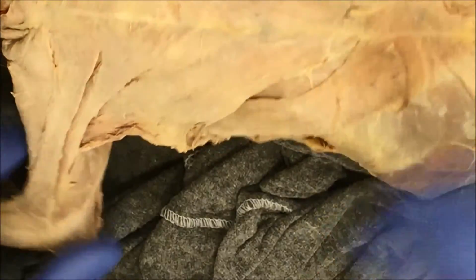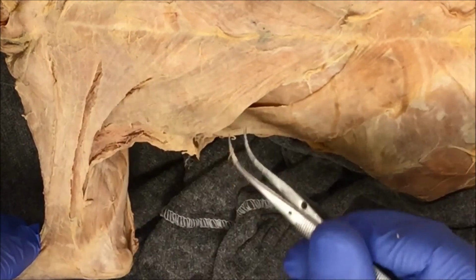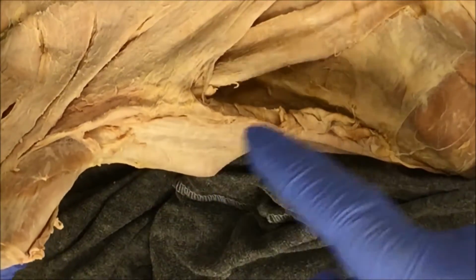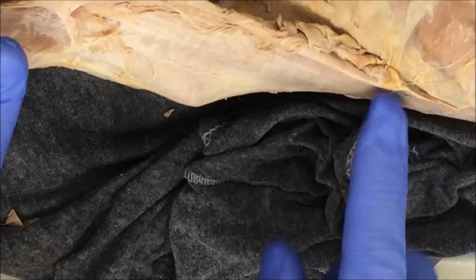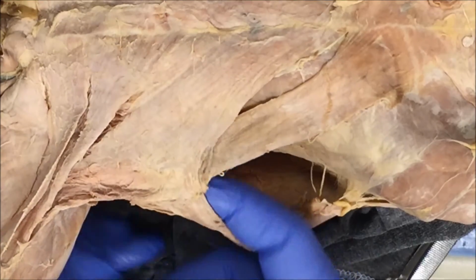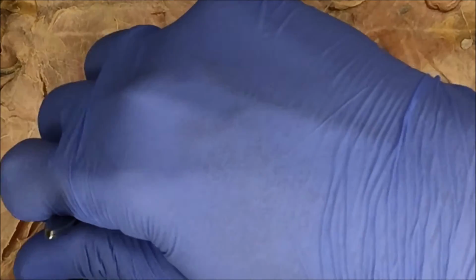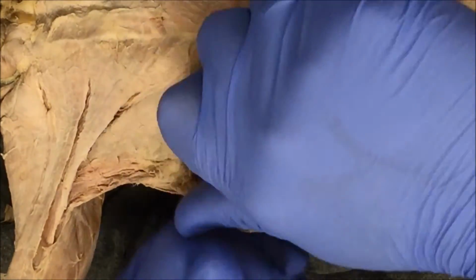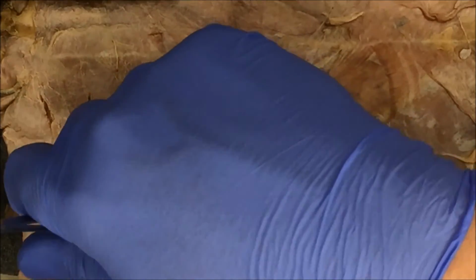So the surface chest muscles, again, are the pectoantebrachialis, pectoralis major, pectoralis minor, and the xiphihumeralis. Now the deep muscle that we're going to dissect is going to be found under here. The only way to get to it is to separate the latissimus dorsi from the chest muscles right at this location. This gets a little tricky because you don't want to cut any of the surface chest muscles. You're going to reflect the latissimus dorsi and the chest muscles to get to this deep muscle.